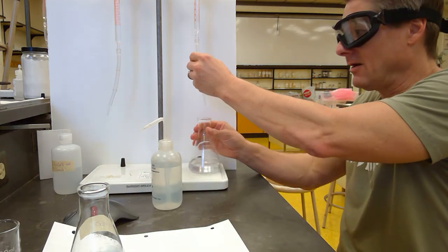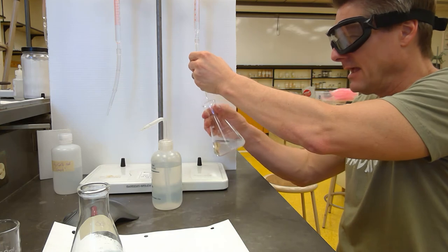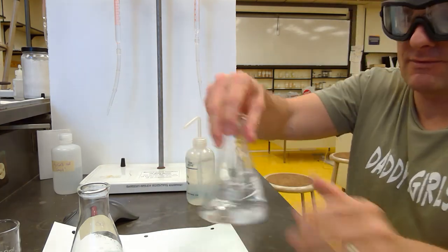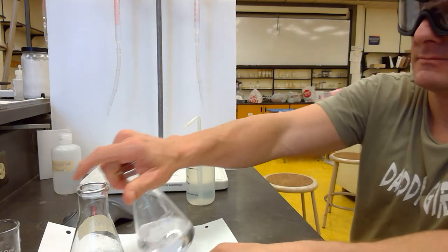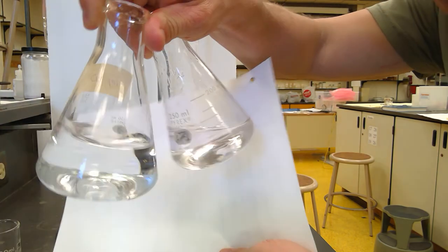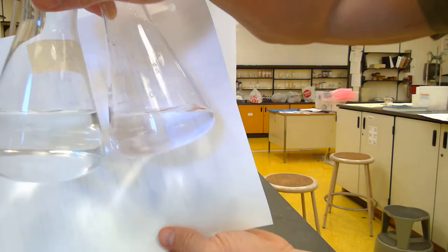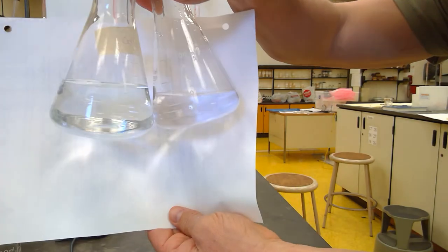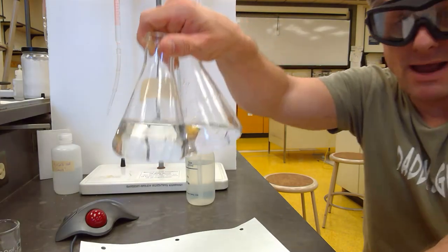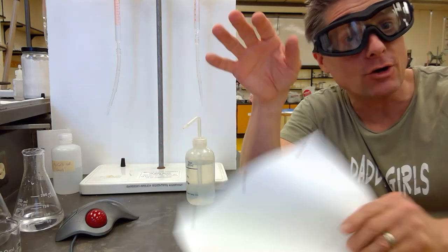All right, we're very close. Don't get in a hurry and just start adding major drops, right? So when you're really close, you want to have some patience there. Can you see the offshoot of pink? So this is my tap water right there. So hopefully you can see that faint. You can't really tell like this, but you're like, oh, there's a real faint shade of pink right there. All right, it's always nice to have the white background. So that's the faintest pink color that you're looking to hit.